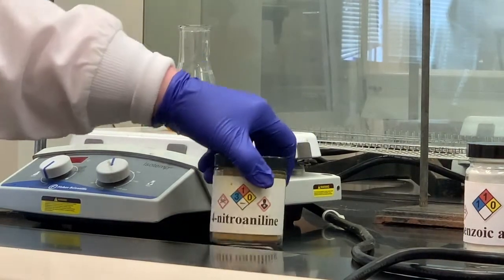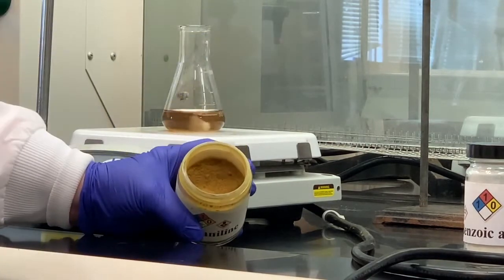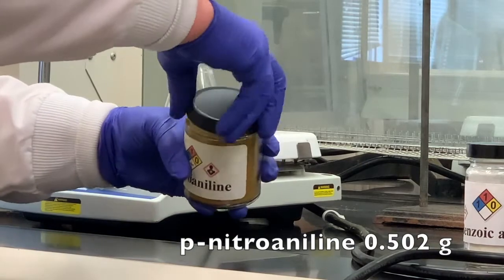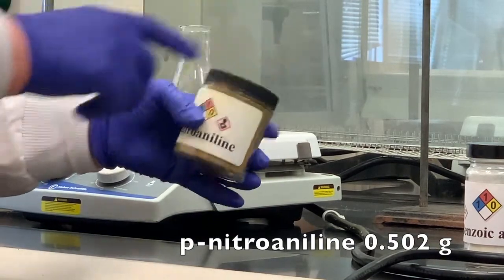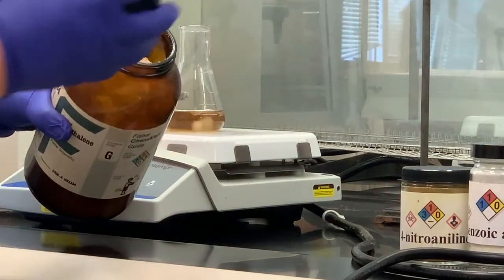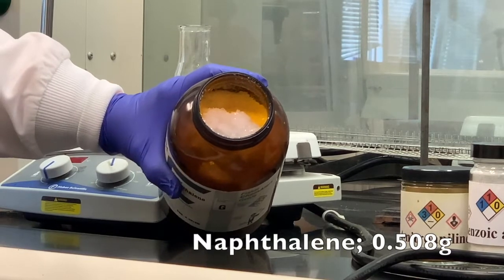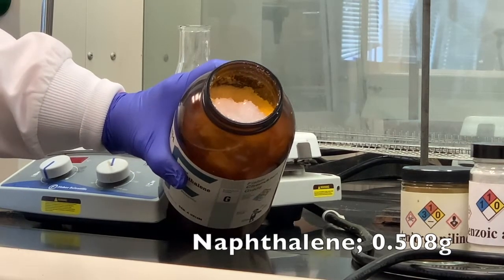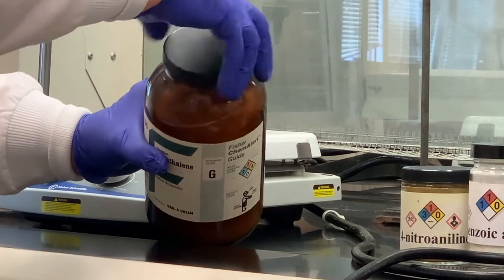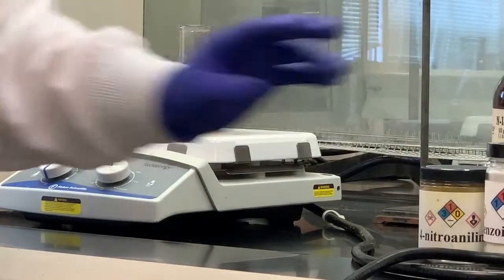Here is the p-nitroaniline or 4-nitroaniline. It has that brownish yellow appearance. And for the p-nitroaniline, I used 0.502 grams. And then the last substance we're going to have in our mixture is naphthalene, and it's a white crystalline solid as well. And for the naphthalene, I used 0.508 grams. Naphthalene, if you've ever smelled mothballs, that's the smell of mothballs. I'm sure you've smelled that before.